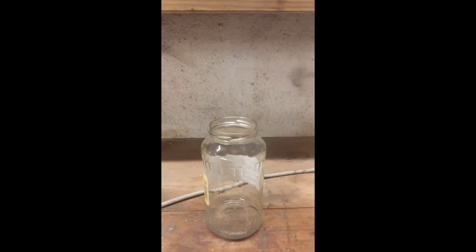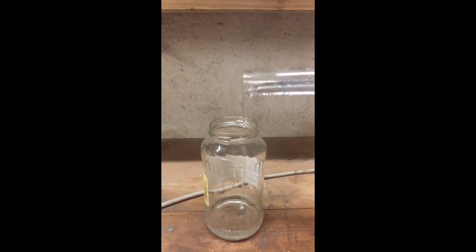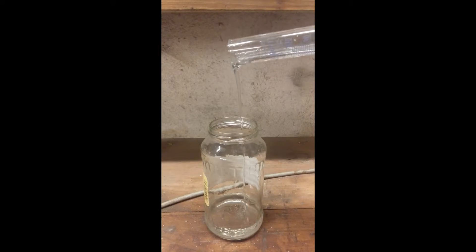Get a jar or a beaker you don't really care about, pour 100 ml of the solution you made and wash your graduated cylinder with water. Water is not a problem here.